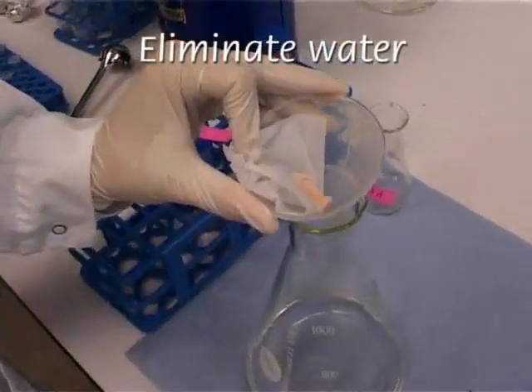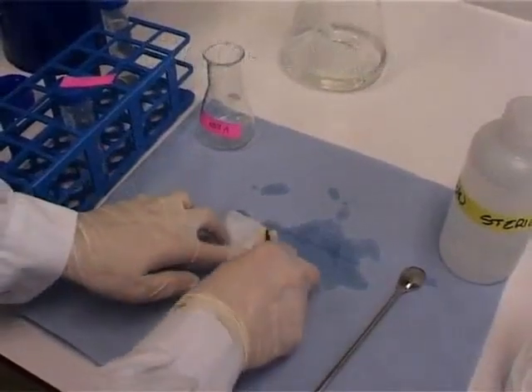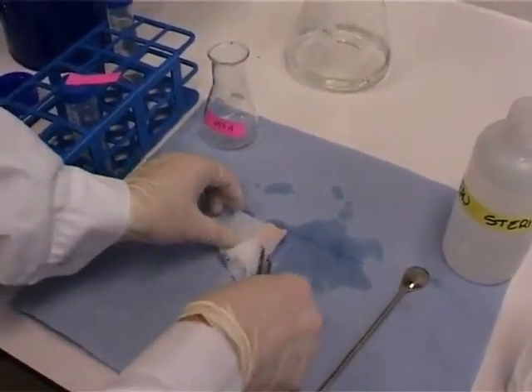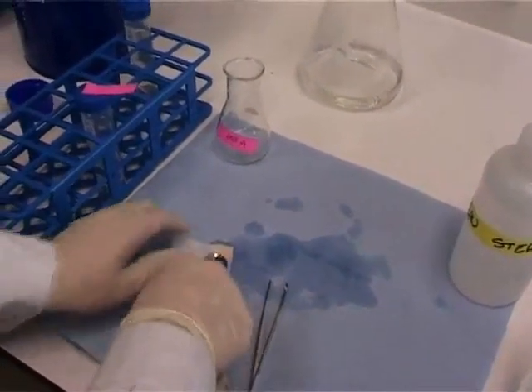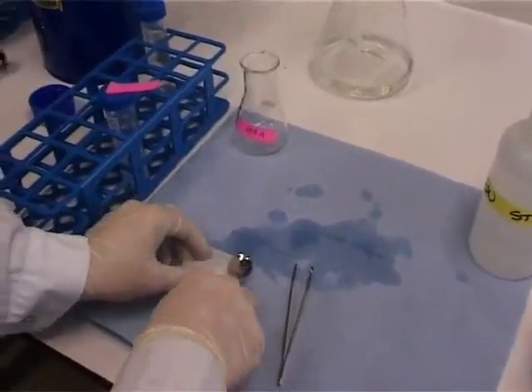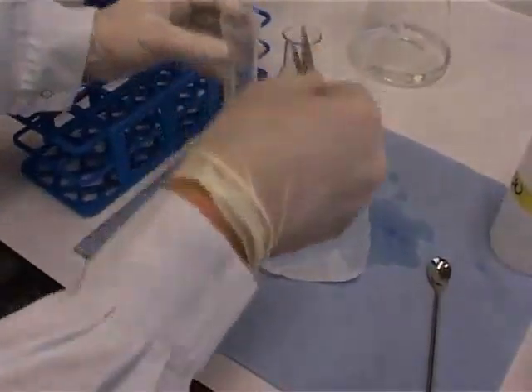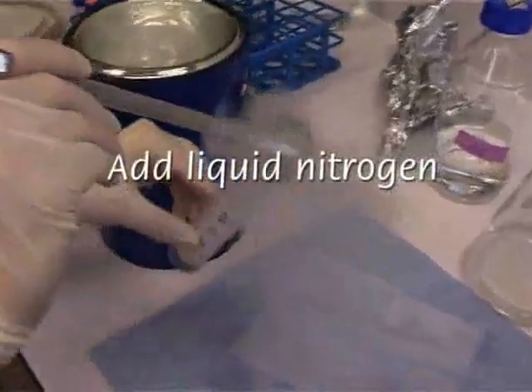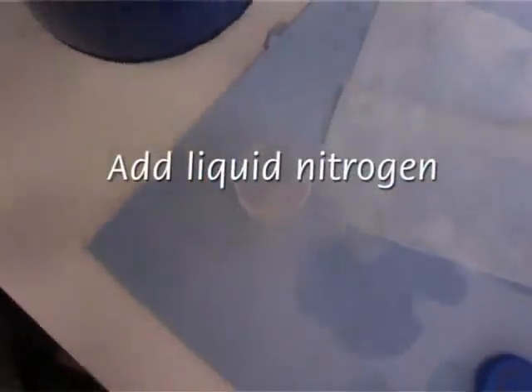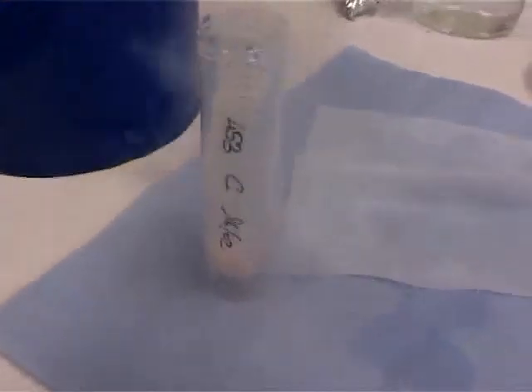The excess water should be eliminated. Afterwards, liquid nitrogen is added and samples can be stored at -80 or used for protein extraction.